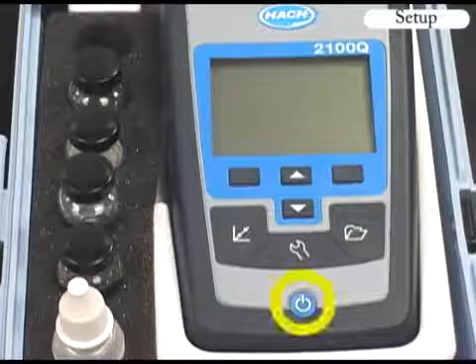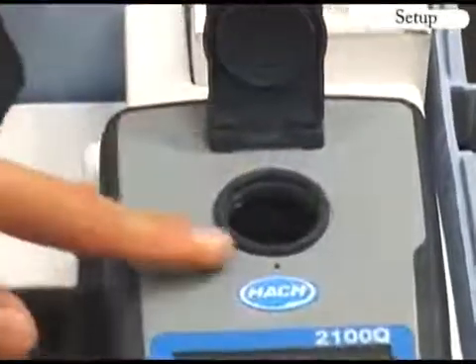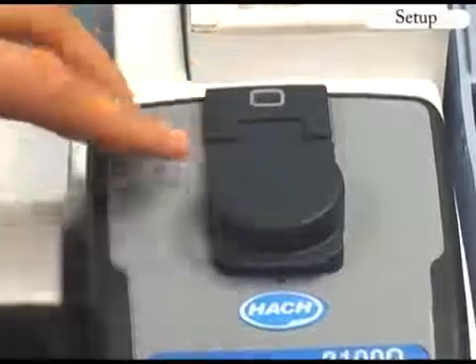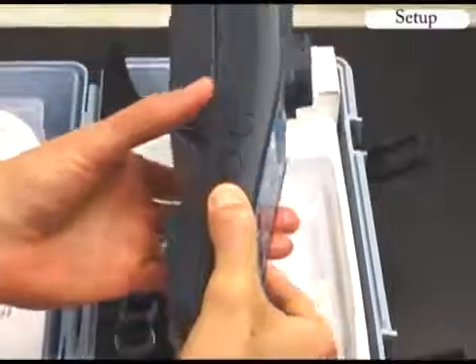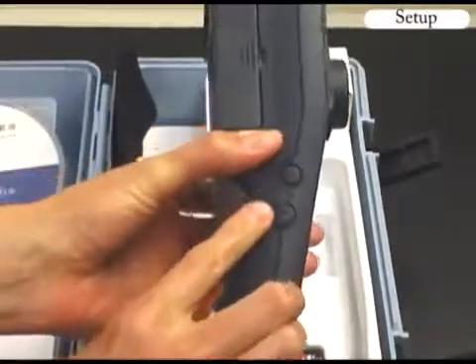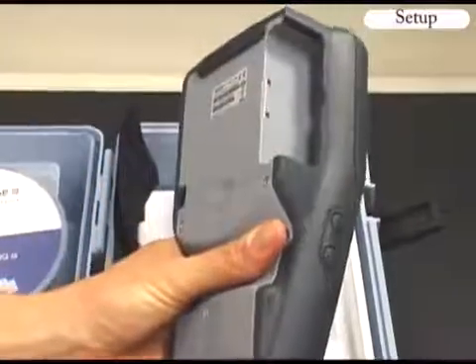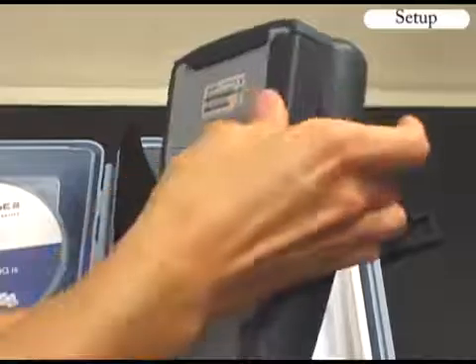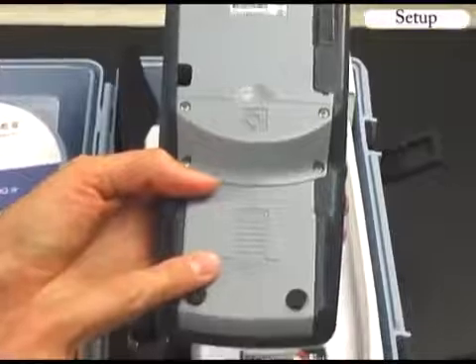On the top of the instrument are the power button, sample cell holder and lid, alignment arrow for sample cell orientation, and attachment location for a lanyard. The backlight keys are located on the side of the instrument along with the module compartment where the optional USB plus power module is installed. On the back of the instrument are the lamp compartment and the battery compartment.